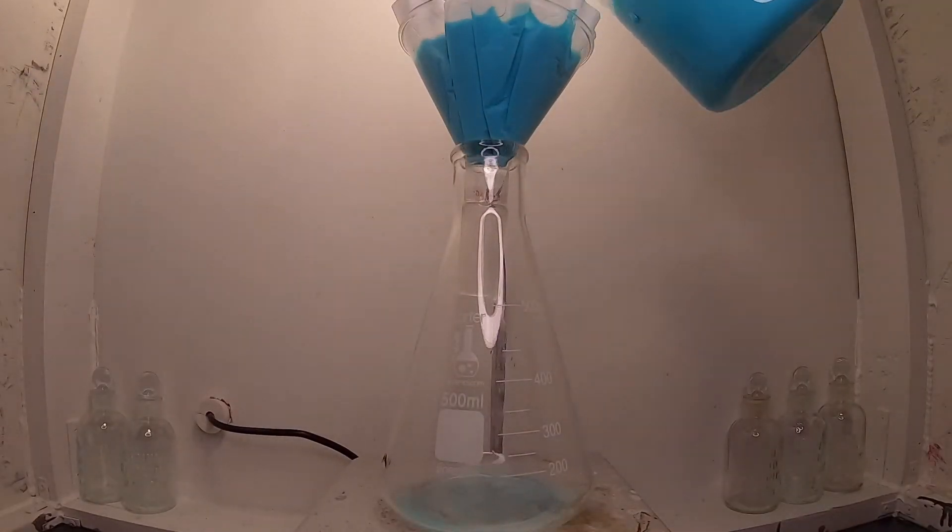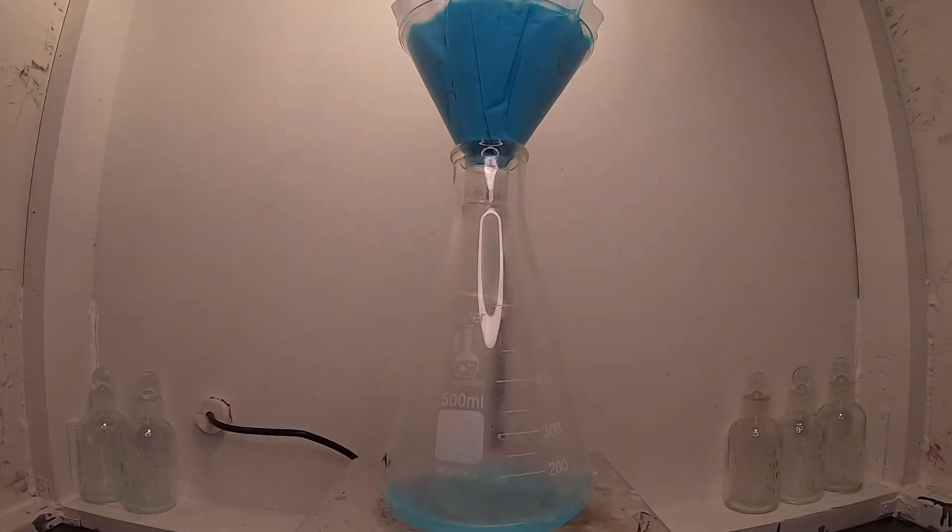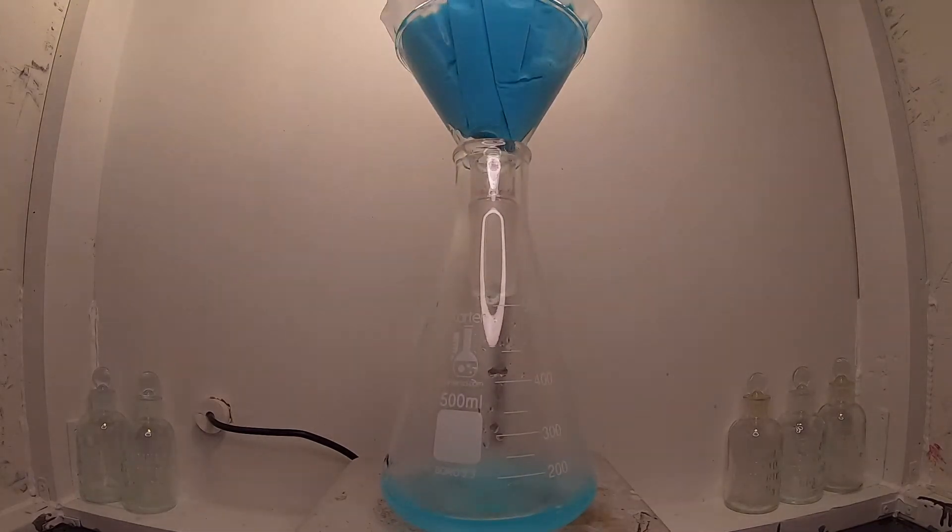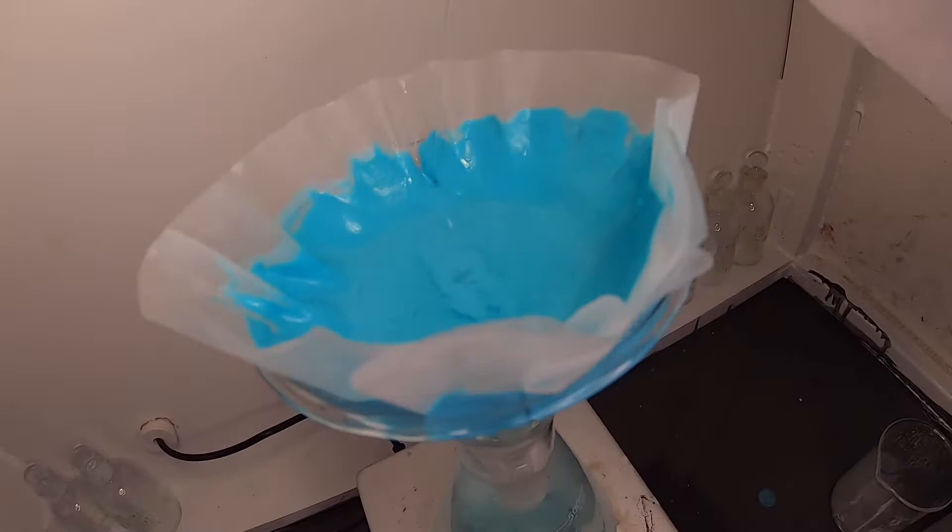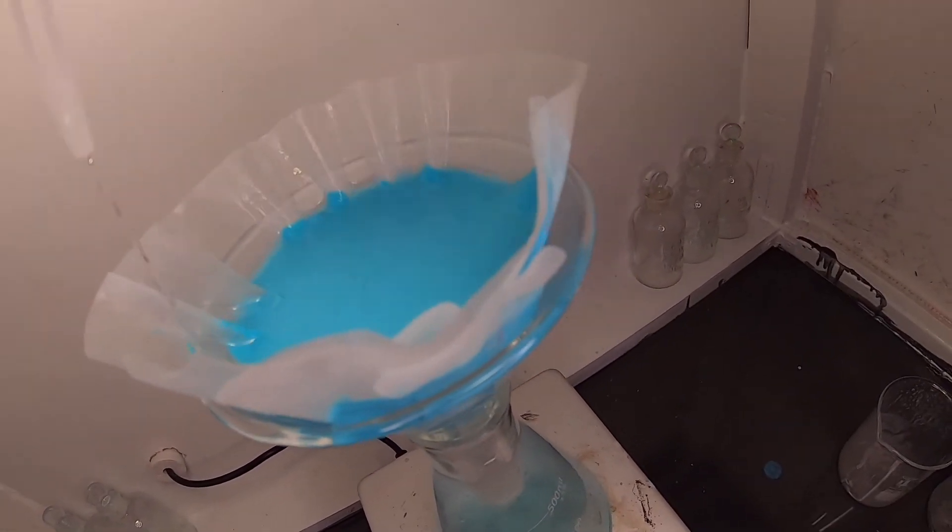The copper carbonate is not soluble in water, so it can be filtered to separate. Rinsing with cold water helps get rid of any leftover sodium sulfate.